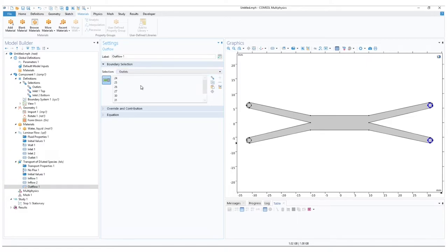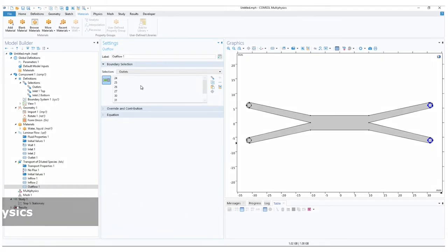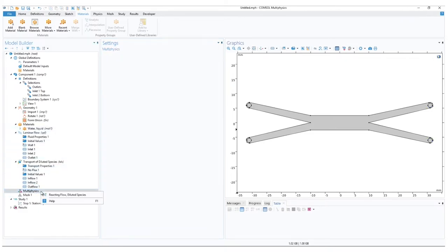Last physics left to configure is the multiphysics option, which creates an interaction with our two different physics. Under the model builder ribbon, right click on the multiphysics and add Reacting Flow, Diluted Species.